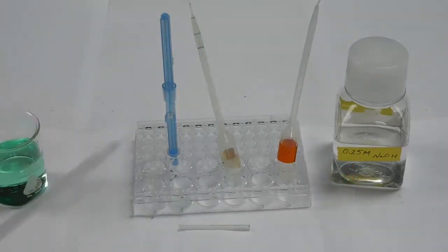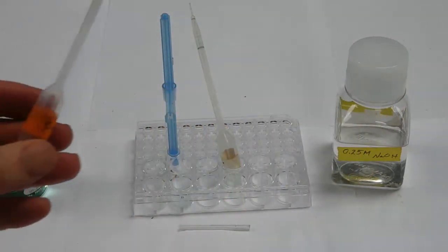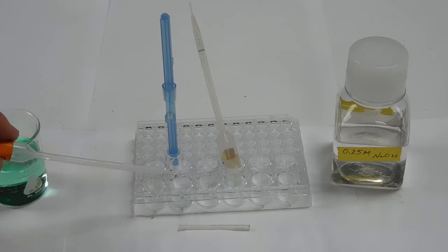And now I'm going to add some phenolphthalein to that, marked PTH, my abbreviation for phenolphthalein. And then I'm going to turn the microtip pipette very slightly downhill, because I know that phenolphthalein comes out of the microtip pipette very quickly.